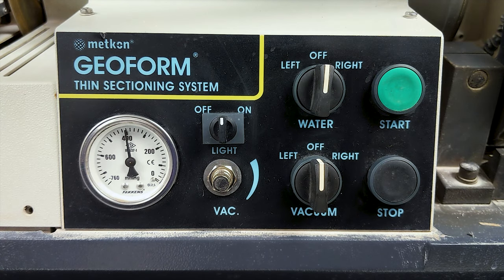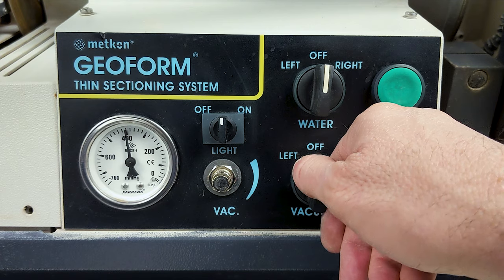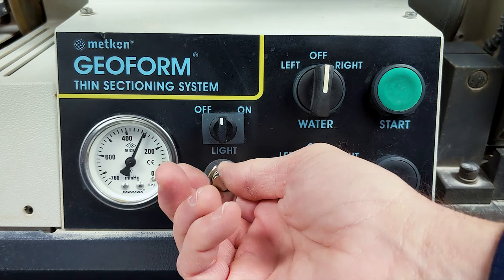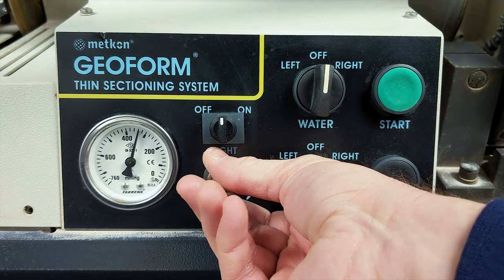From the GeoForm control panel, we can turn on the vacuum for either the cutting or grinding module and monitor and control the amount of pressure holding our sample slides in place.